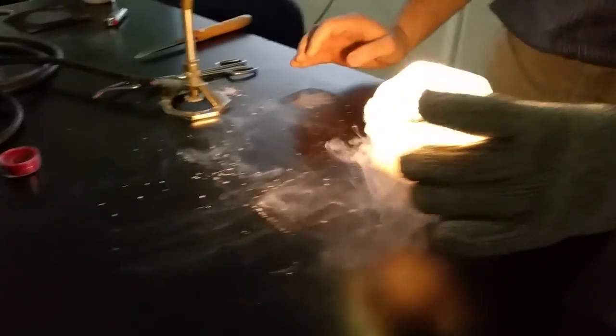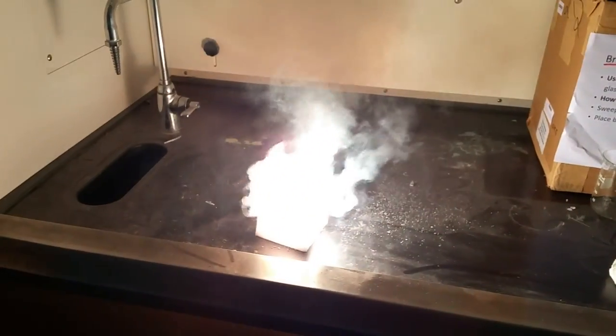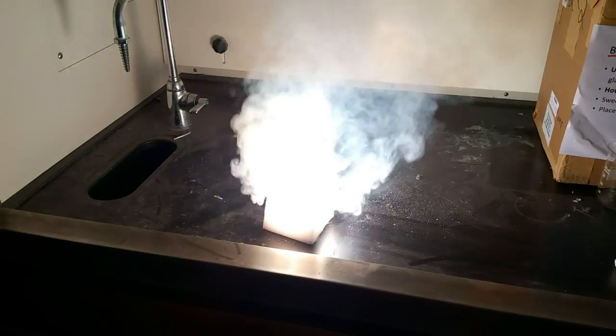Oh my god. Now we're going to put it in the fume hood. Oh! Oh, David! Oh! That! Can I take a picture? Come on. This is too long.